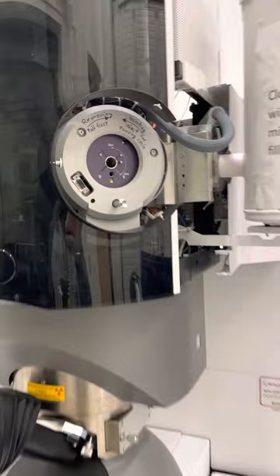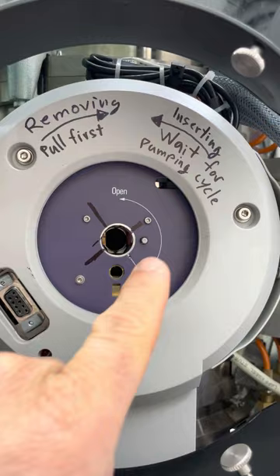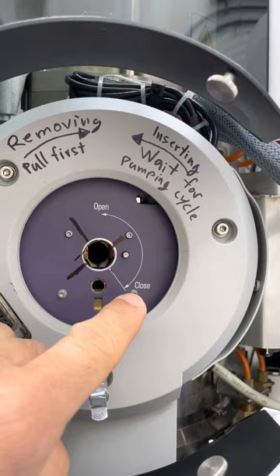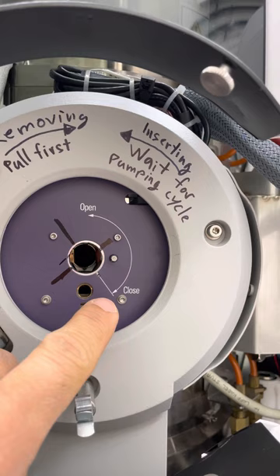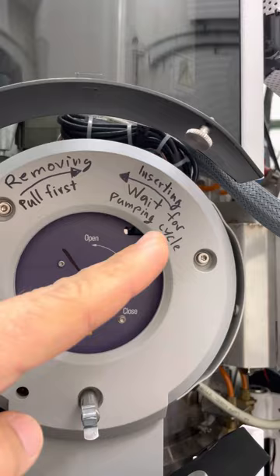So here is the goniometer. I put some marks here. You see the closed position and the open position. There's a little pin in the specimen holder that should line up with the closed position. When the pin is lined up with the closed position, the tip of the holder, which is flat, lines up with this mark here, which is perpendicular to the pin.